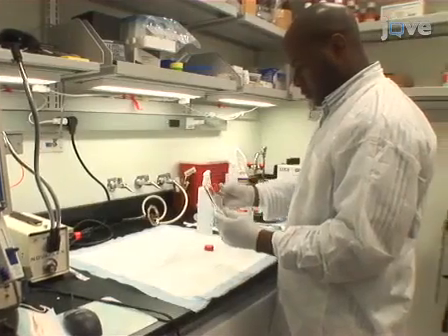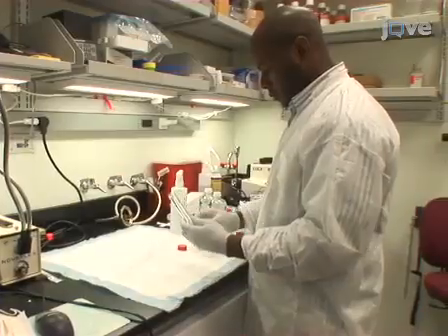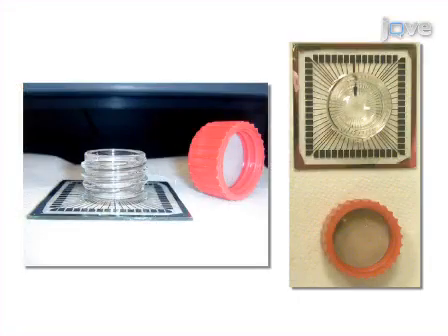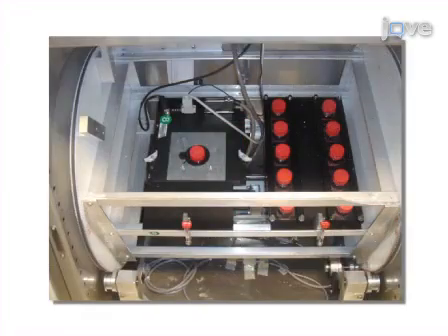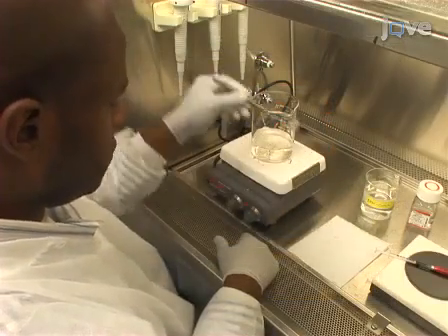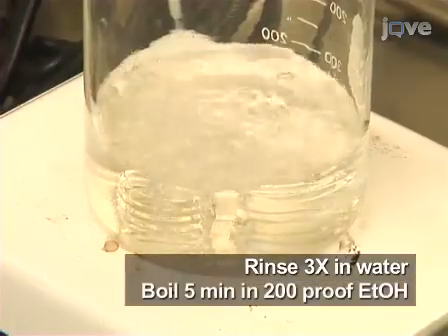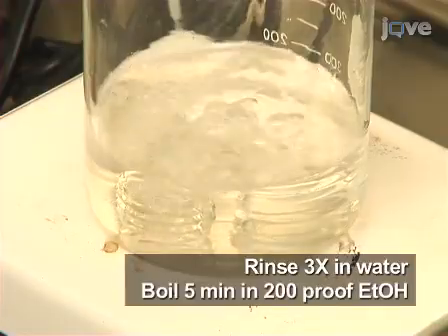To prepare a sterile sealable glass chamber for recordings, first cut threaded glass cylinders with a Teflon plastic cap approximately 2 mm from the bottom of the thread. These are required for secure and tight culture chamber closure. Then, clean the glass rings by rinsing them with water 3 times, then boiling for 5 minutes in 200 proof ethyl alcohol. Set these aside to dry.